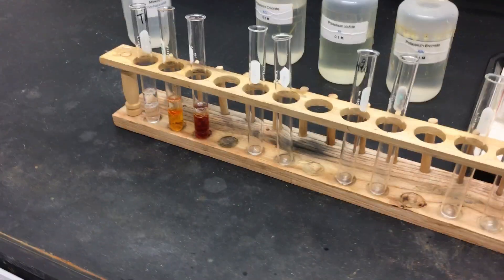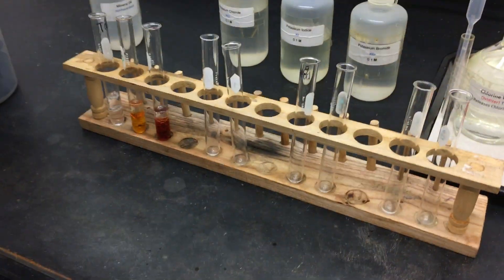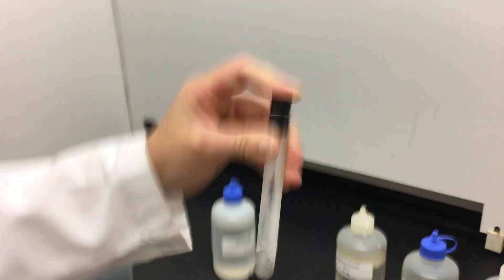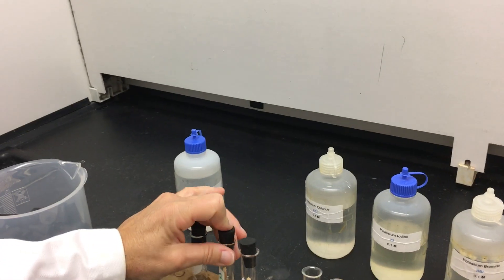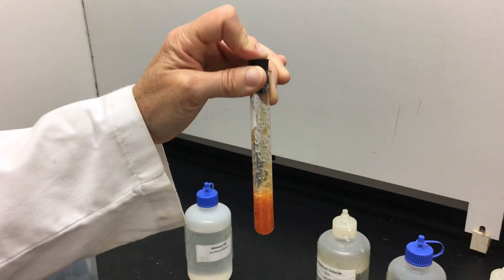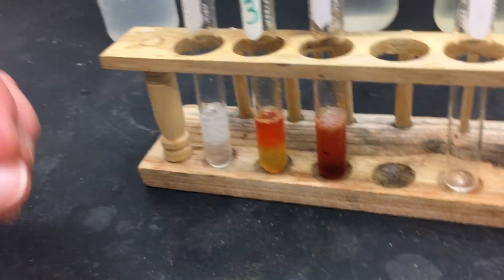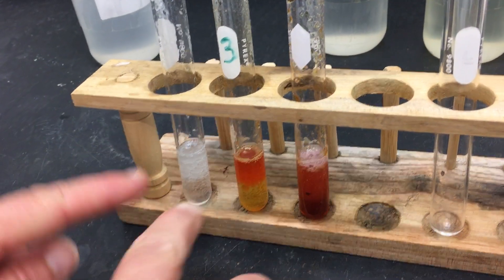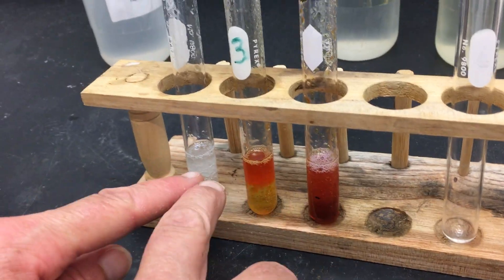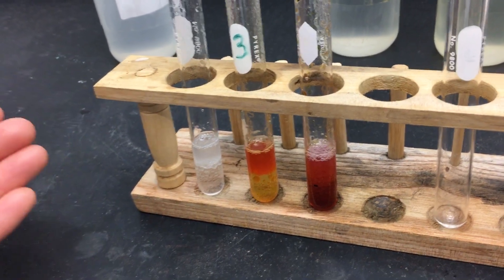The procedure tells us to shake each test tube vigorously — shaking the chlorine water, shaking our bromine, and shaking the iodine. One of the properties of halogens is that they're more soluble in the mineral oil layer, which is the top layer, than in the water layer, which is the bottom. So we want to watch as the layers separate and look at the characteristic color each forms.